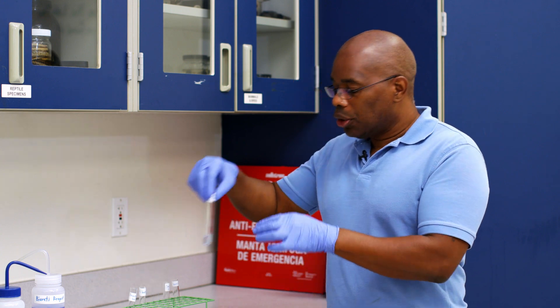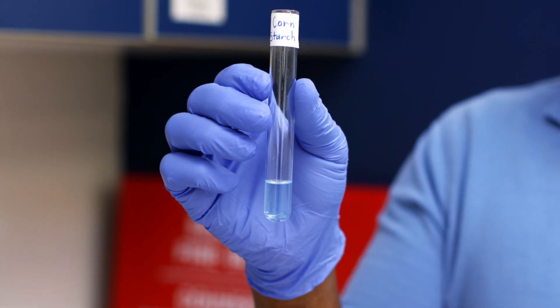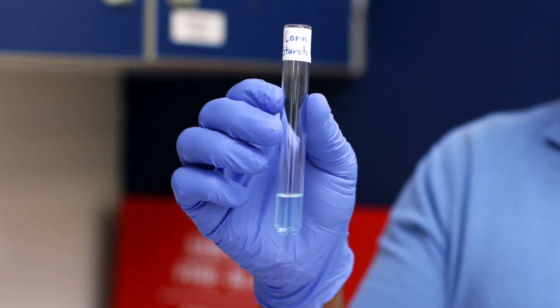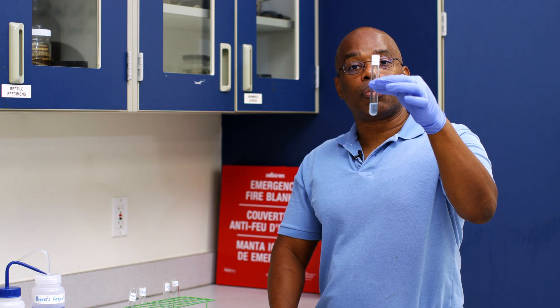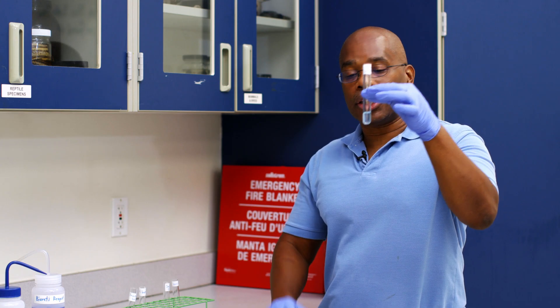Our next solution is cornstarch. Again, we see a negative control — no color change. It still looks like the original color of the Biuret reagent.